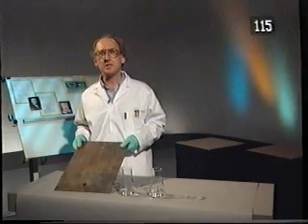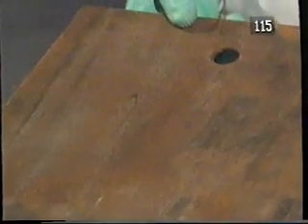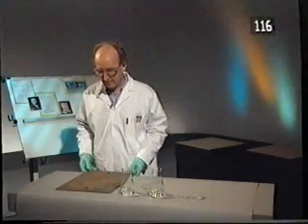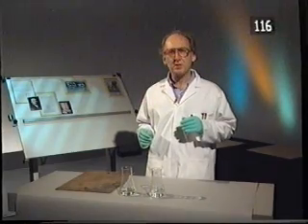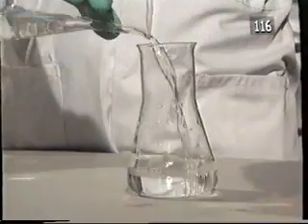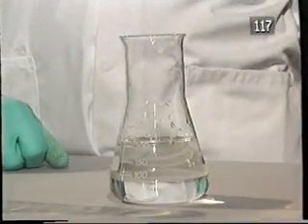Take, for example, rusting. If I look carefully, I can't see rusting going on, but I know that rusting has taken place because originally this metal plate was clean. Another reason why we might not see reaction is because there may not be a physical change. Have a look at this reaction. There, reaction has occurred. Did you see it? If I were to analyse the reaction mixture, I could show that reactants had been converted to products.